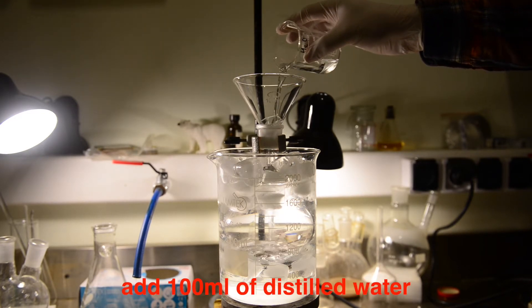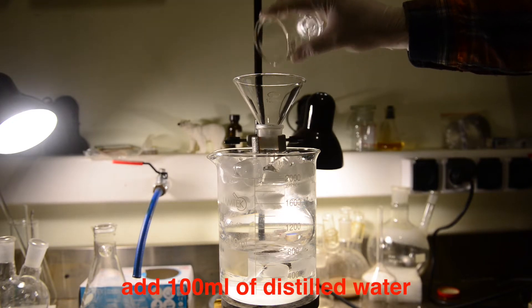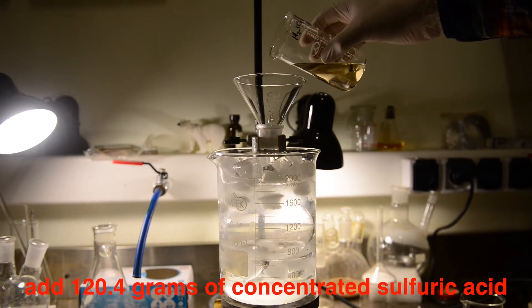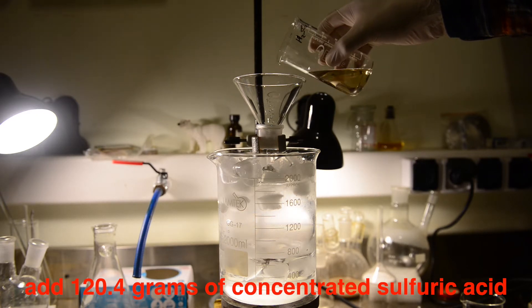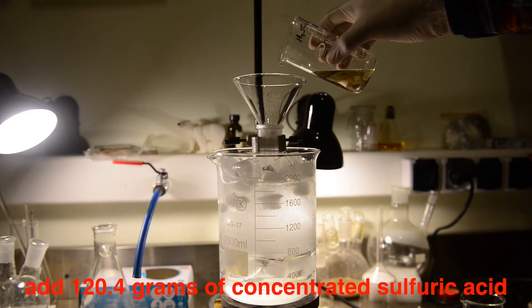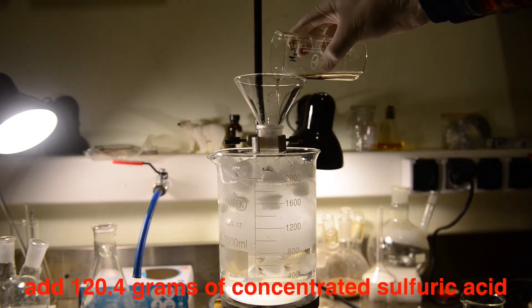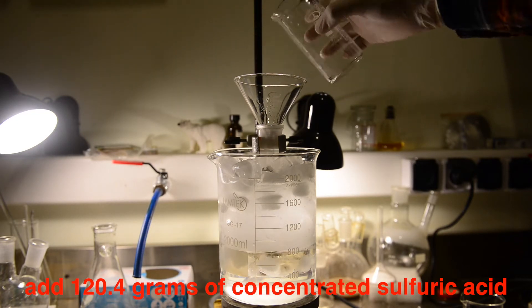we placed 100 milliliters of water. The flask itself was placed in the ice bath, and 120.4 grams of concentrated sulfuric acid was added in small portions. It is always mandatory to add acid to water and not vice versa, because during an addition, the massive heat is generated and boiling acid might be spilt on your skin.